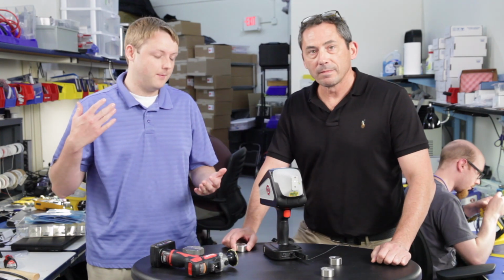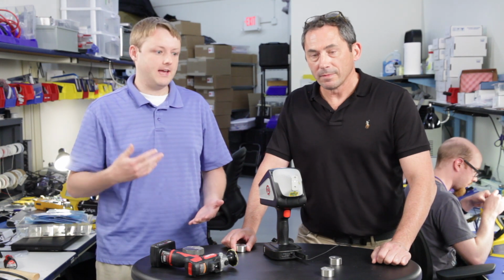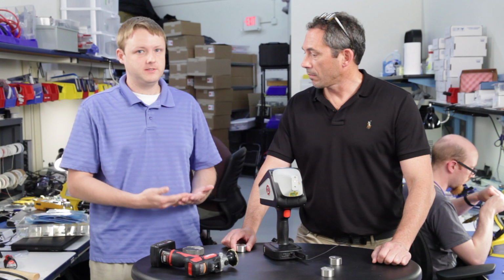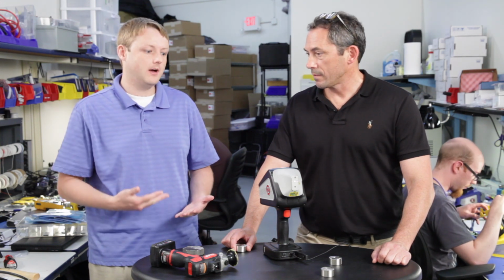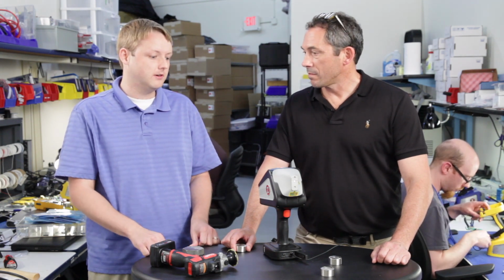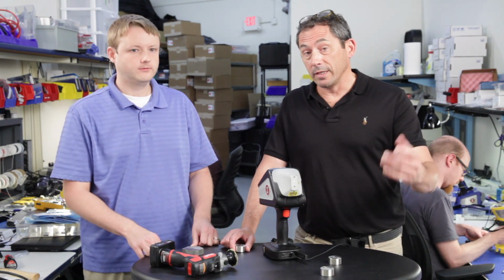We're looking at separations of 0.01, 0.02%. And the carbon line, as we mentioned in some of our other videos, is deep down in the UV, 193 nanometers, where argon really helps you get as much signal as possible out of your spectrum. Plus, we learned a lot from these guys that have done Spark OES.